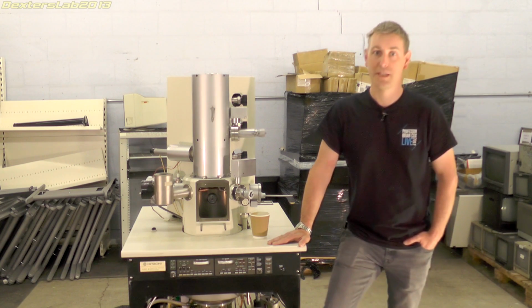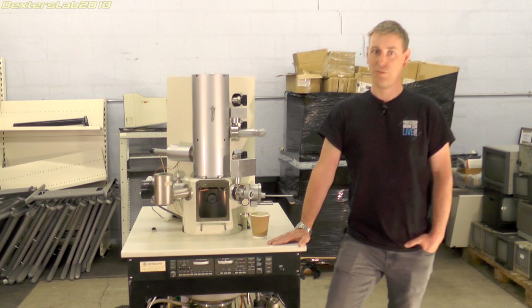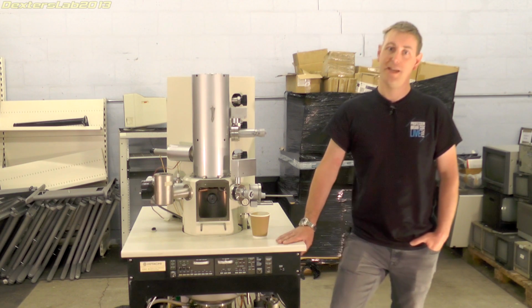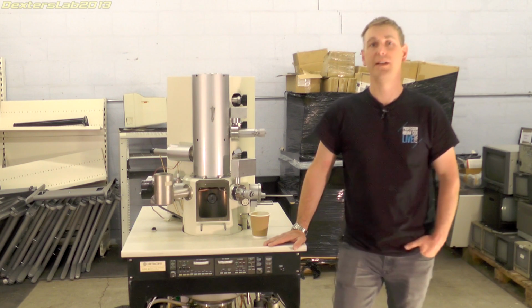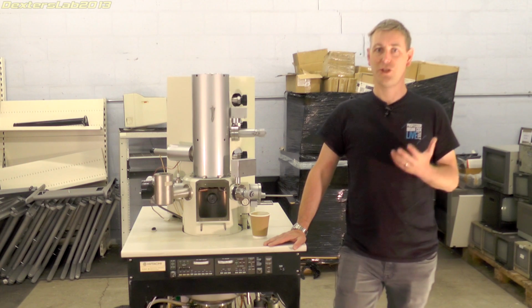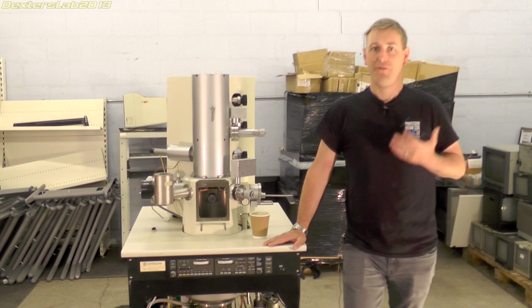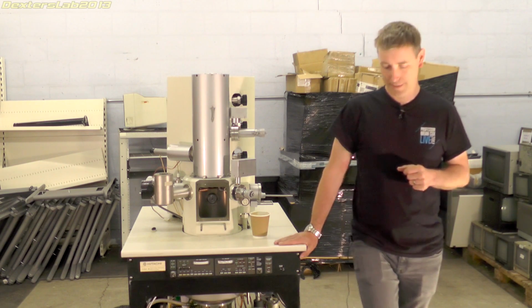Now, as always with things like this, the principles of operation and the actual reality of a commercial product are often very different, and that's why things like this get more and more complex, as manufacturers refine and improve what might be a basic idea into something that actually does the job accurately and reliably. Now, before we get started, there are a few things I want to say about this.